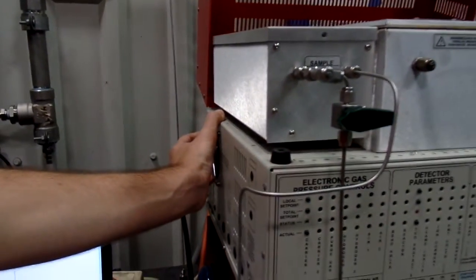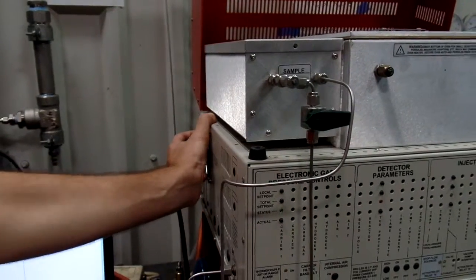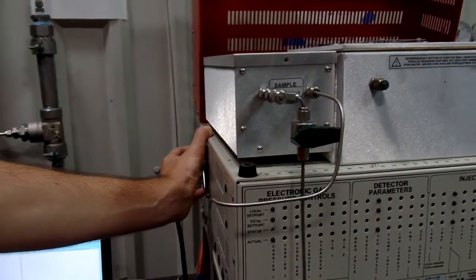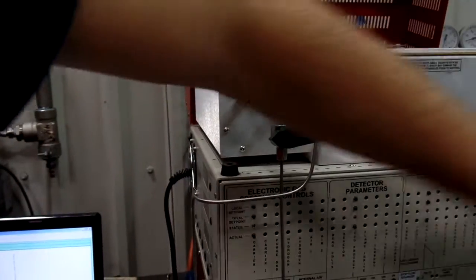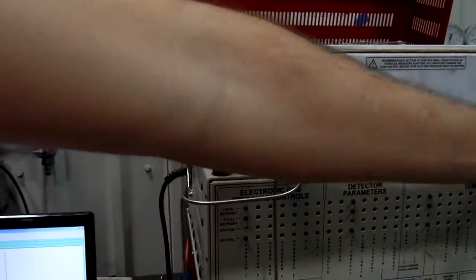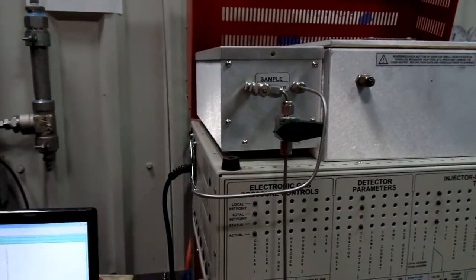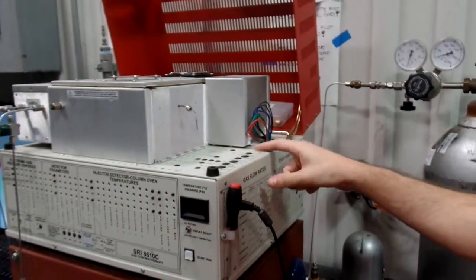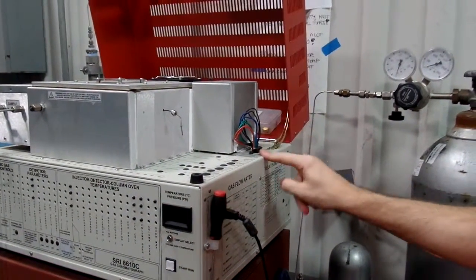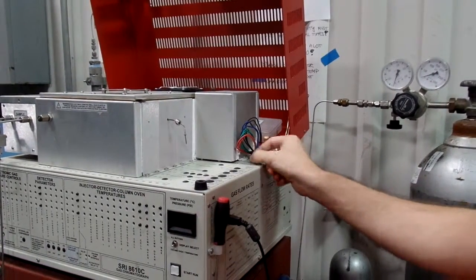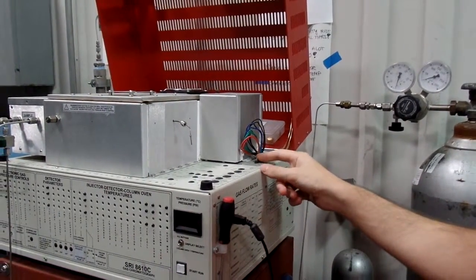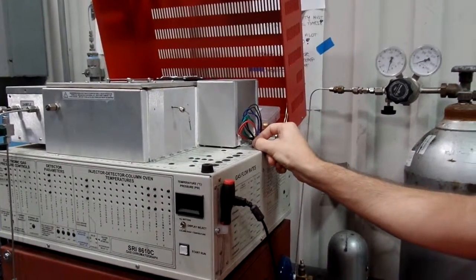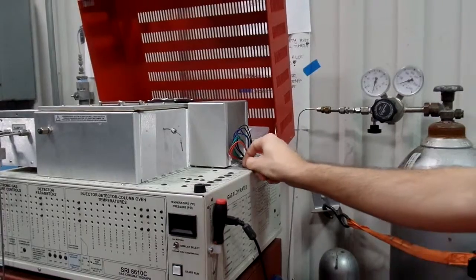So the first thing you have to do before you turn this on is you make sure the argon valve is open and flowing and it will flow through here without this being on. So once you've checked to make sure it's flowing through, you turn on. And then you put the amplifier on low. Just clicks there. It's usually stationed on off when it's not being used. But we don't use high. I don't really know the reason why. I think it's just set for what needs to run and that's it. So click that on low.